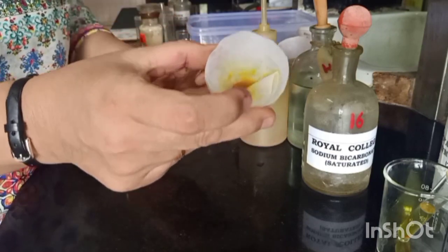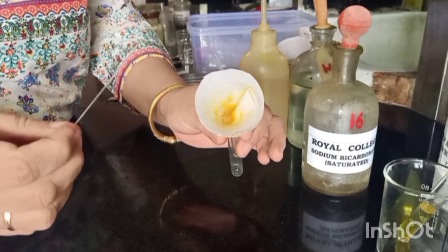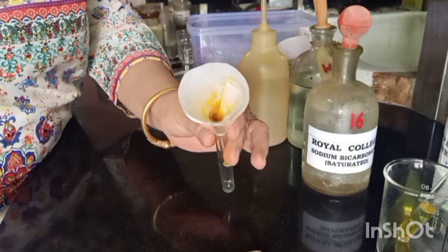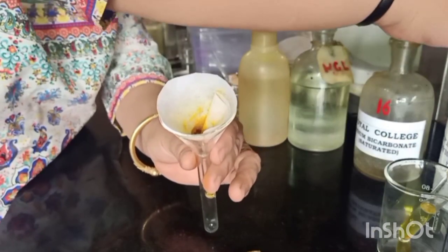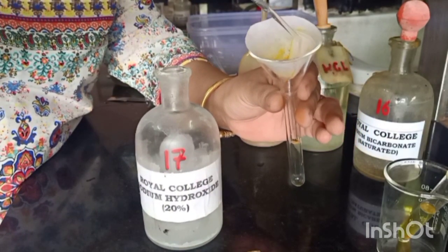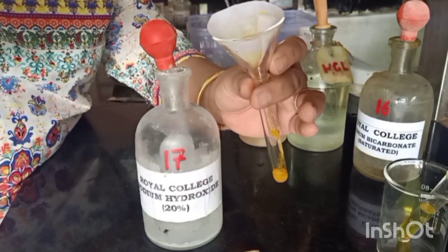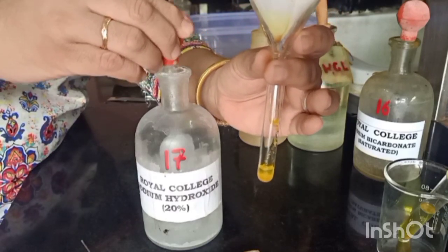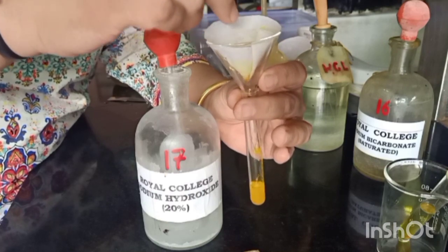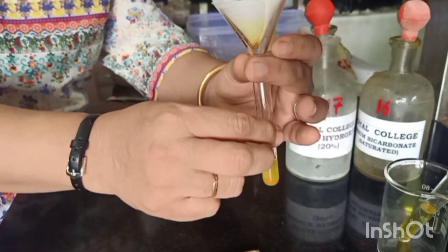So let's transfer this residue to check for a phenol. Normally we would just open the filter paper and collect the residue, but a simple way is to just make a hole in the filter paper and pour the reagent through. The reagent for phenol that has to be used is sodium hydroxide. So let's add sodium hydroxide to this. As you can see, all the residue is coming down — it makes transference much easier by this method, particularly when working with small quantities on a micro scale. The residue has come down; now let us shake it vigorously to check whether it has dissolved.